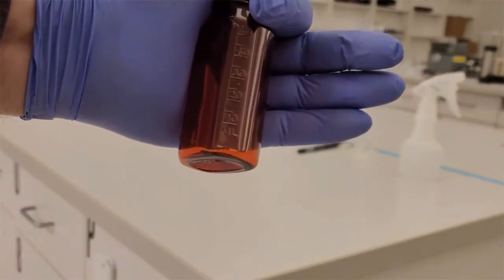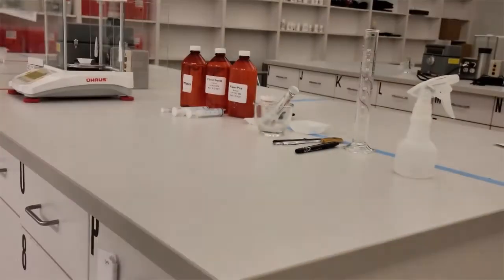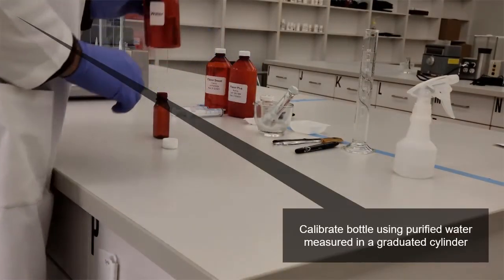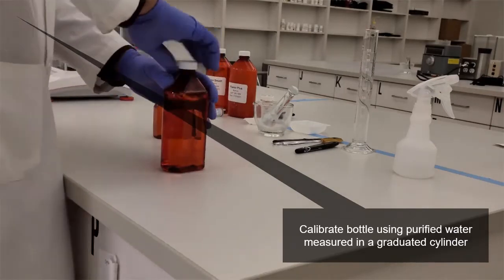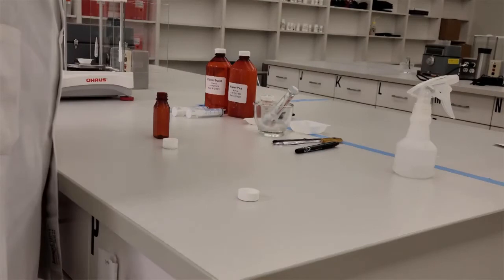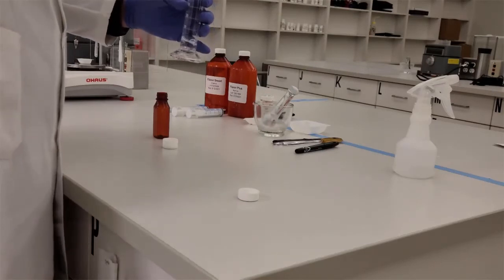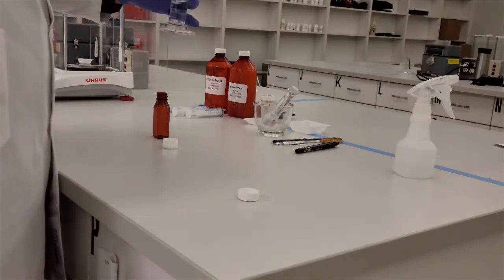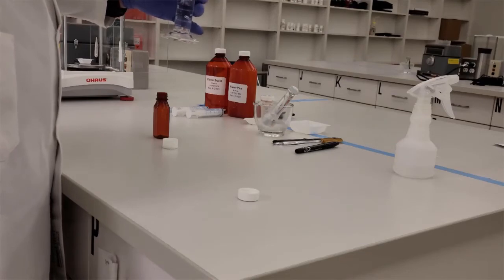So we need to calibrate that bottle to, for my prescription here, 35 mLs. So how am I going to do that? I'm going to get purified water, put it into a graduated cylinder. That graduated cylinder will act as my appropriate measuring device.